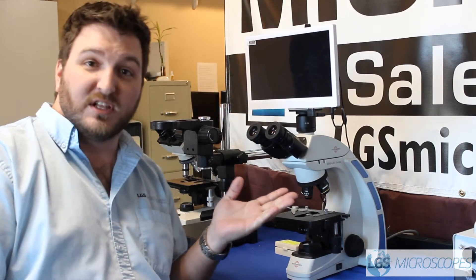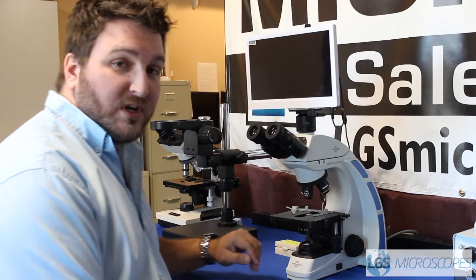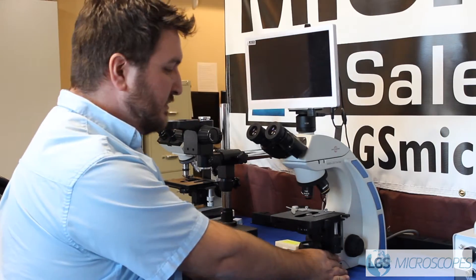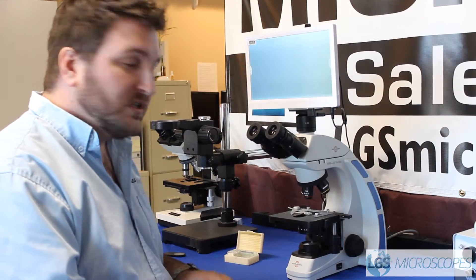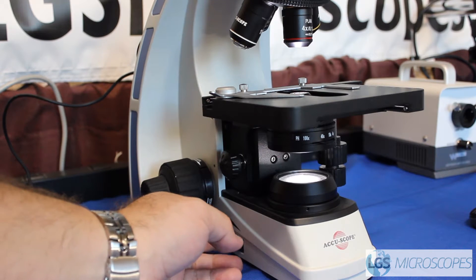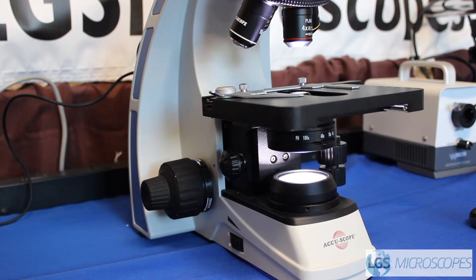Hi, welcome back to LGS Microscopes. I'm Paul and today we're going to go over how to use a basic clinical microscope. The first thing you want to do is turn it on. This one has a power switch right over here, go ahead and switch that on. At first the light might be kind of dim because if the last person used it correctly they would have turned the light all the way down, so we're going to turn it up just a little bit, maybe about halfway.